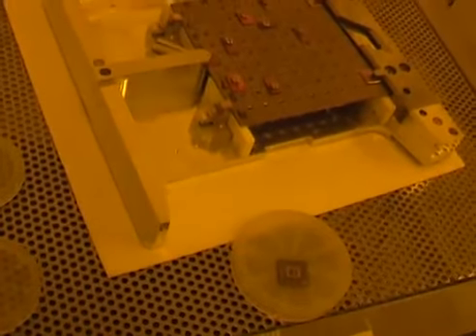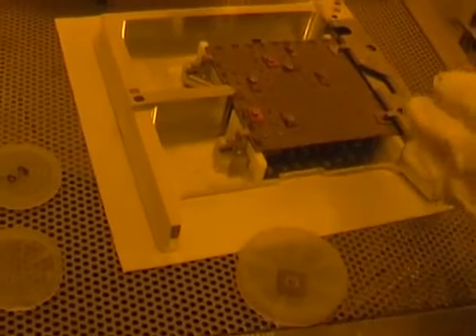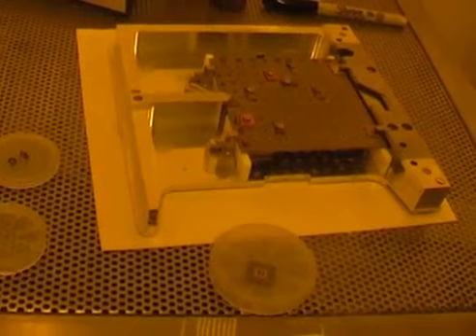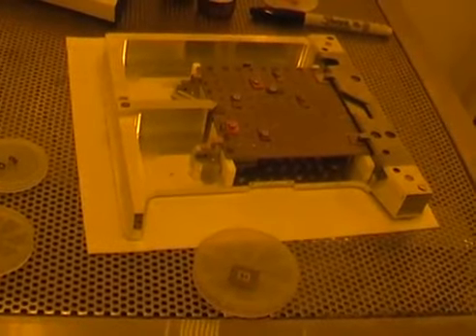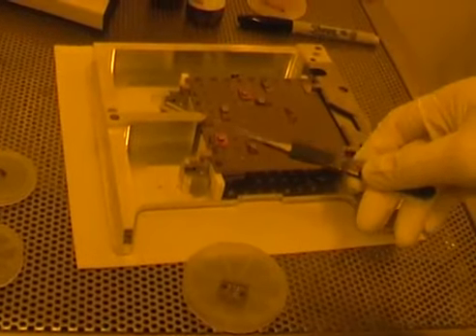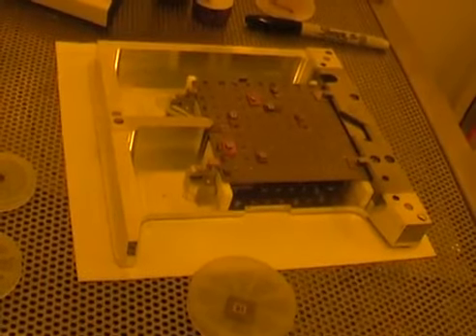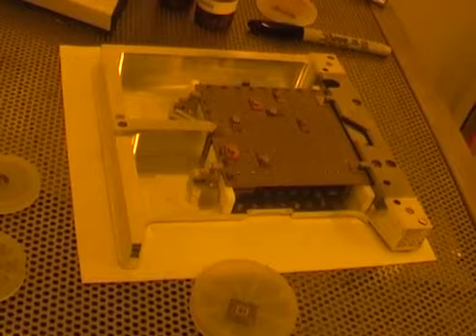Okay, the next stage then is to load it in here, but of course I need to be very careful to put the cross at the bottom left corner. Now you might think that this is the bottom left corner. You'd be wrong. It's a slightly complicated situation.